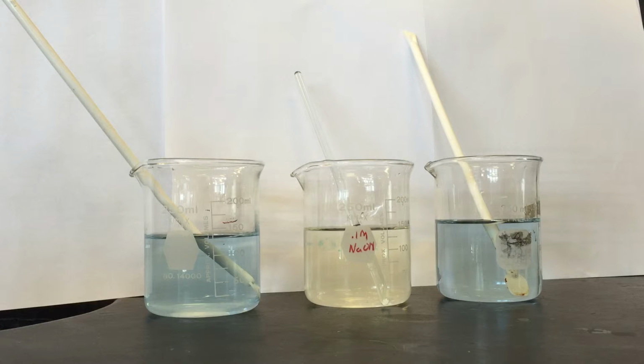After we added the potassium dihydrogen phosphate and dipotassium hydrogen phosphate to the second and third beakers, and then added 3 drops of hydrochloric acid to the second beaker, the solution did not change color. It remained a greenish color, meaning that there was no pH change. However, when we added the rest of the hydrochloric acid to the second beaker, the solution did finally change to a yellowish color.